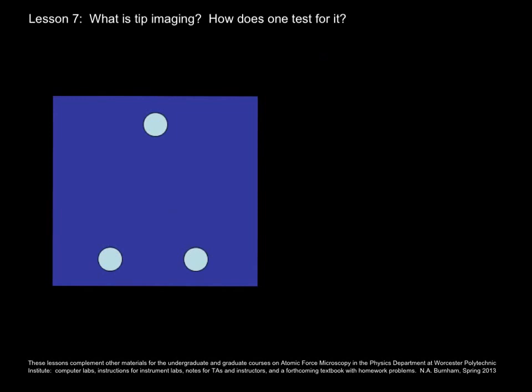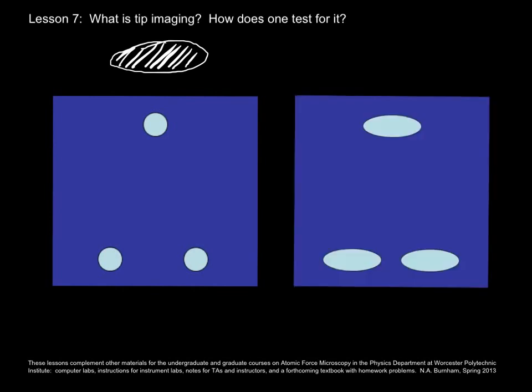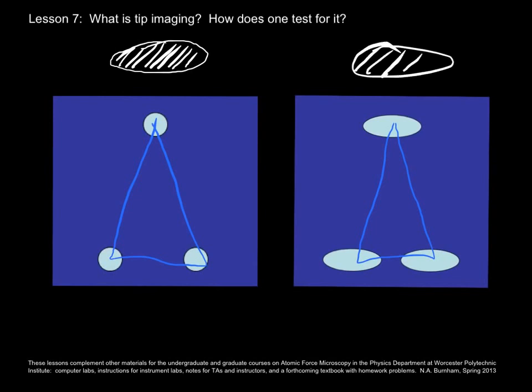If you're following these lessons with a friend, here's a game that the two of you can play. You can say, here's my sample, here's my tip. So, friend, how will the topographic image look? It would look like this. Each feature is still in position. We see the triangle as before, but now the features have become elongated with the same shape as the tip, this way. So you can make up some games like this.